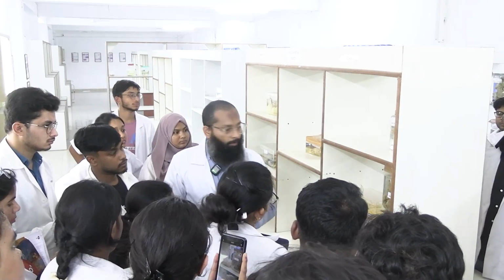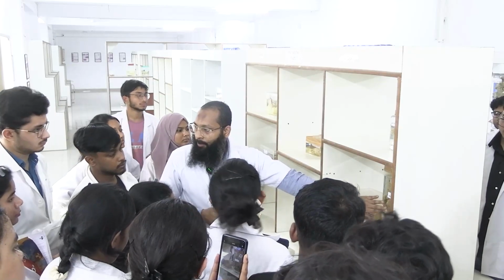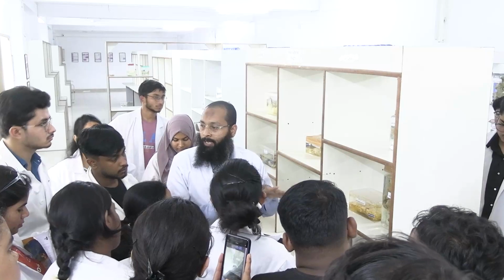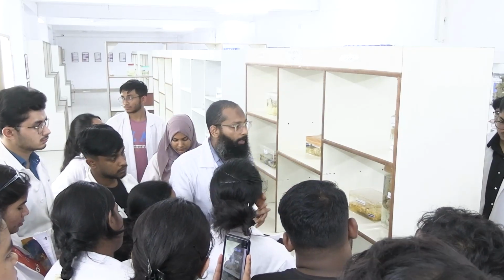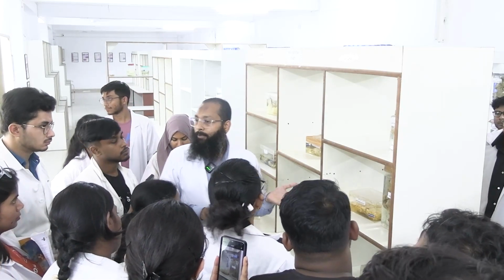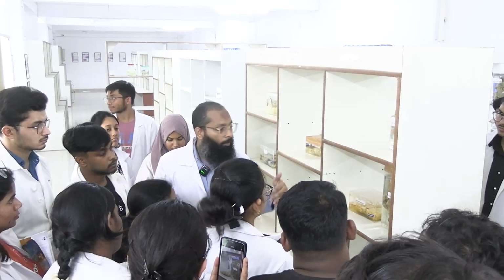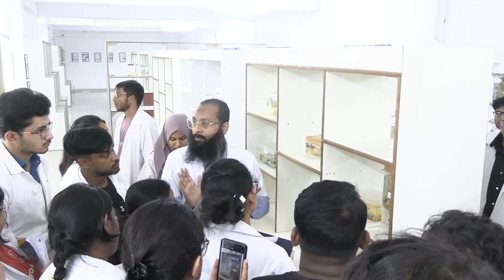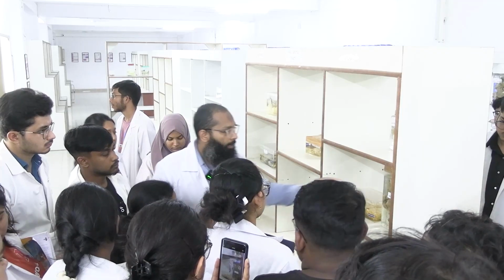Okay, so that is not possible here by looking at this specimen, because first of all you are not able to touch the specimen. Second thing, you don't know its laterality, you don't know its orientation, okay. So it is not possible, but that is also an important point, fine.